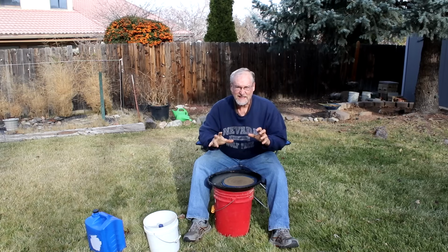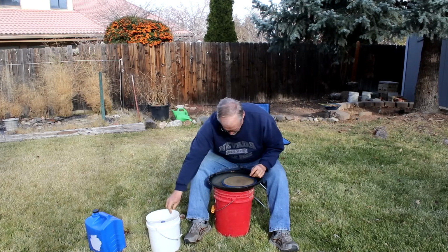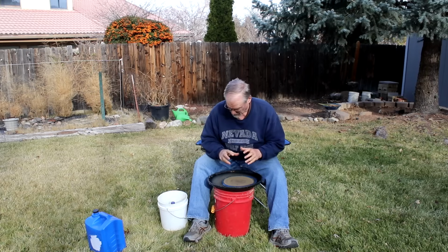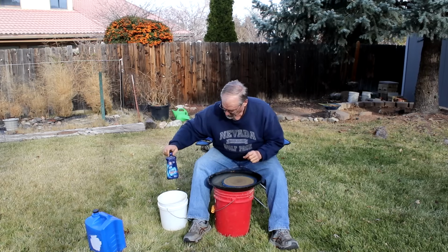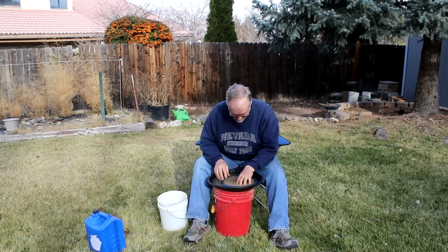Okay, so the final step in separating the gold out so we can measure the weight of the gold that was in our samples is to carefully pan it out. And I've got just the single rock sample. It didn't go through the gold cube because it was only a couple of pounds, but I've got a little bit of jet dry in here, and I'm just going to carefully pan this.